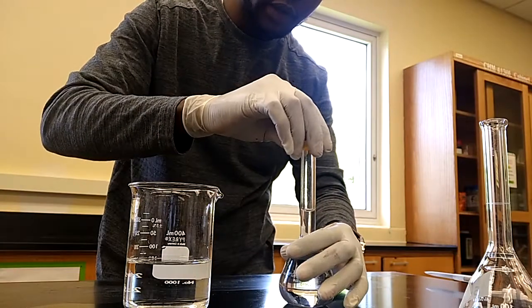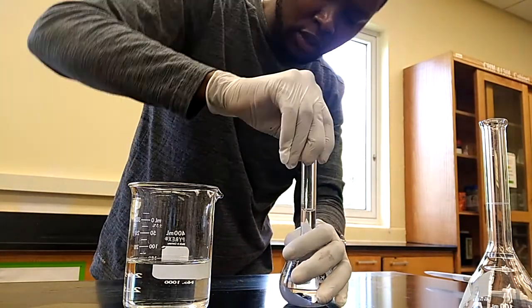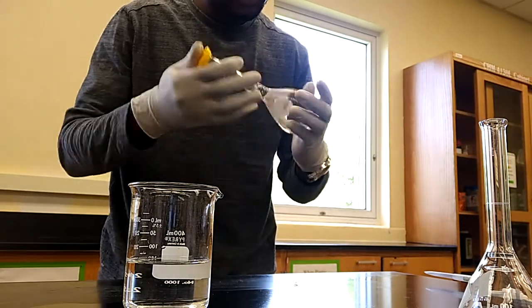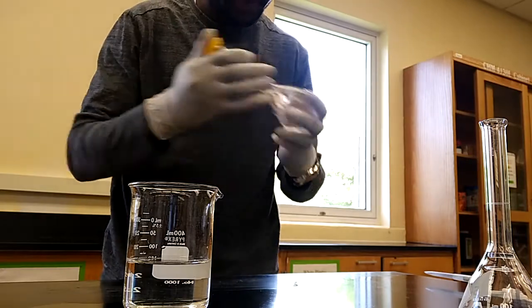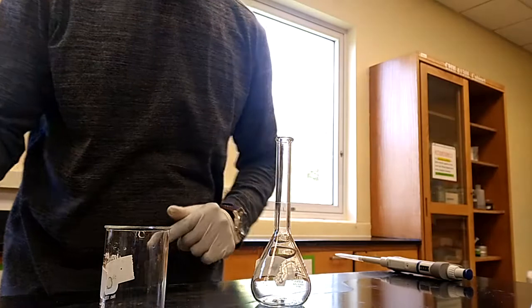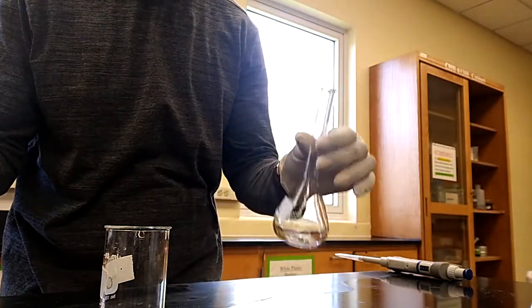Then I will cover my stock solution and swirl multiple times to ensure that the salicylic acid completely dissolves. I have already prepared the stock solution. Now I want to prepare the working solution.